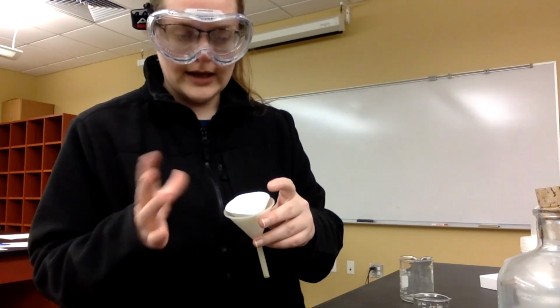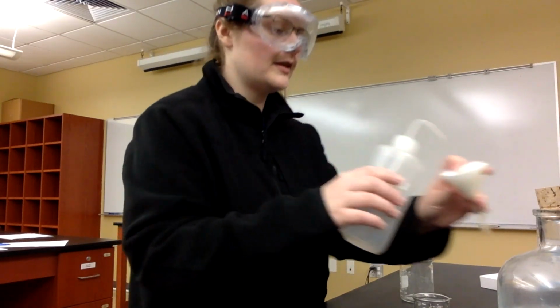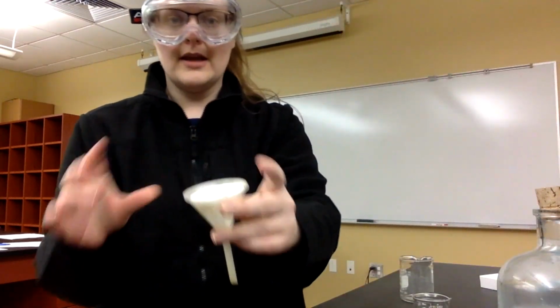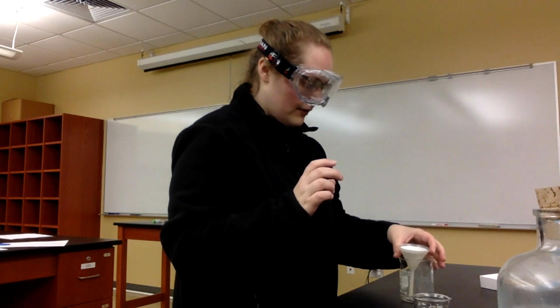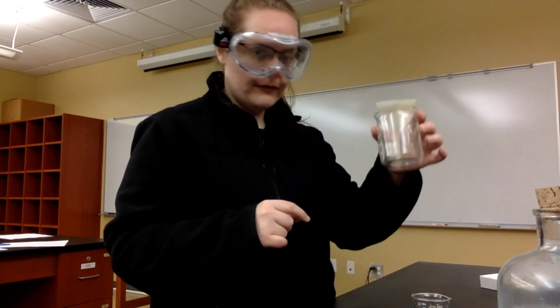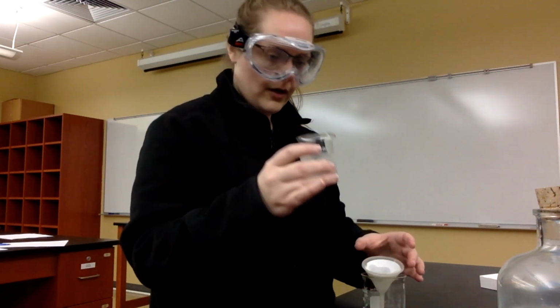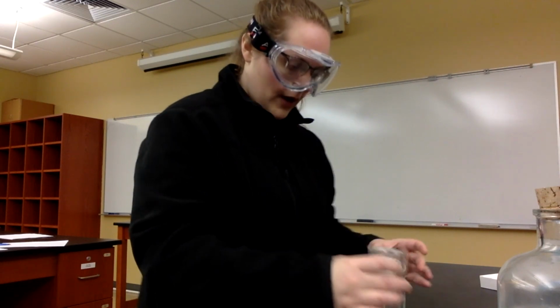When the filter paper is dry, it doesn't really sit there very well, but I can fix this by using a little bit of distilled water to hold the filter paper in place, and the wet paper stays nicely in the funnel. I will then put my funnel with the filter paper into a beaker for collection, and then in small aliquots I will filter out the calcium hydroxide. Not all of the calcium hydroxide will fit into the funnel at once, so I have to monitor to make sure that I'm not overfilling it.